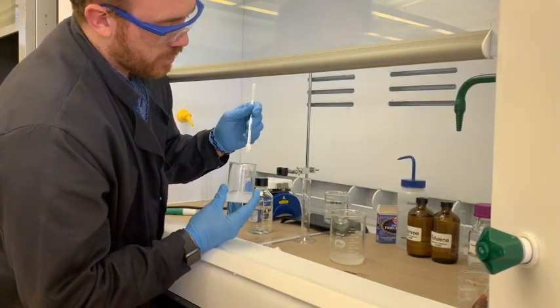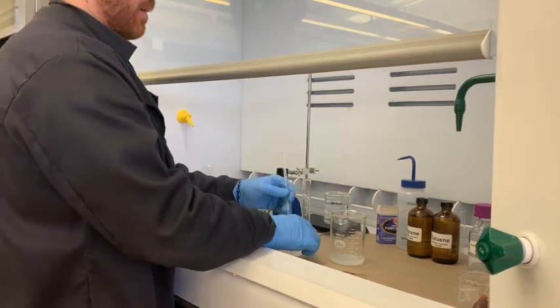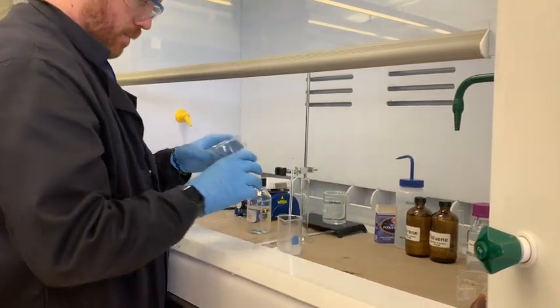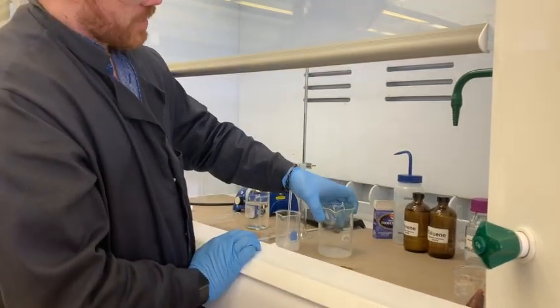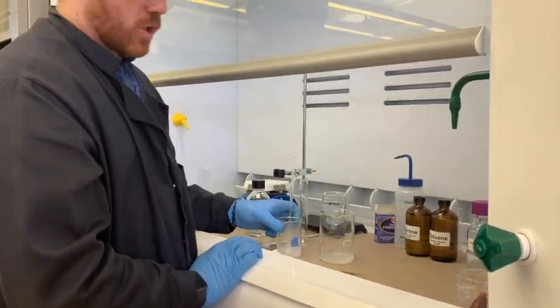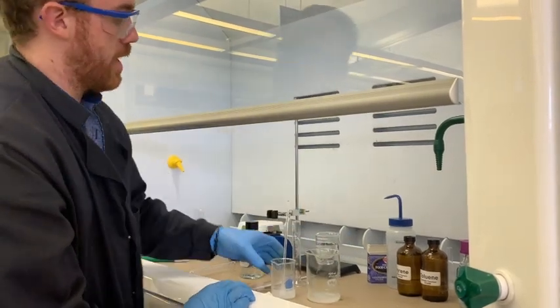So there's a little chunk of it. Hopefully we got more than that. Maybe I lost a little bit in here. Very possible. But for the purpose of what we're doing today, I'm not going to spend too much time trying to go after every last smidgen of that polystyrene.